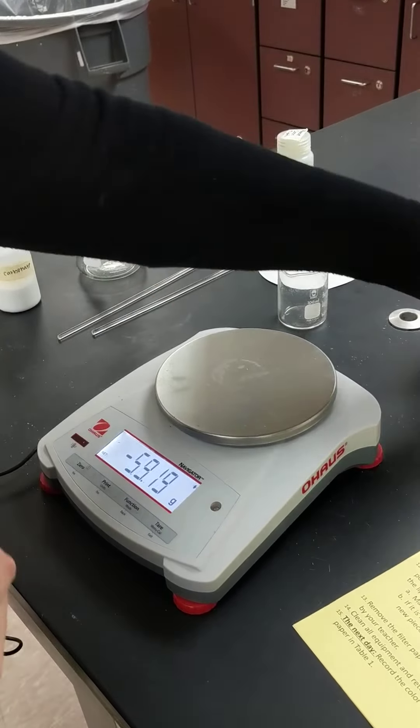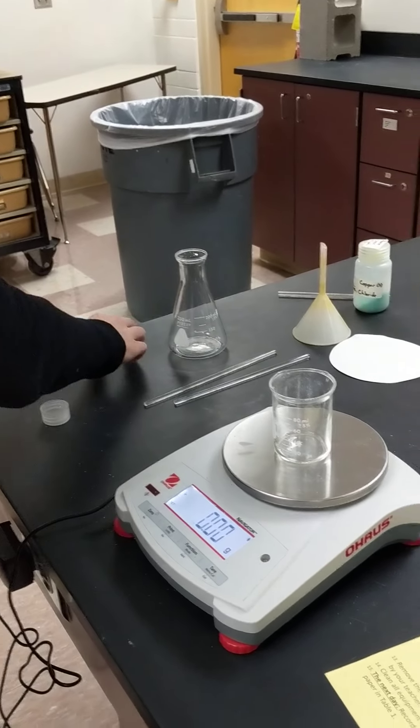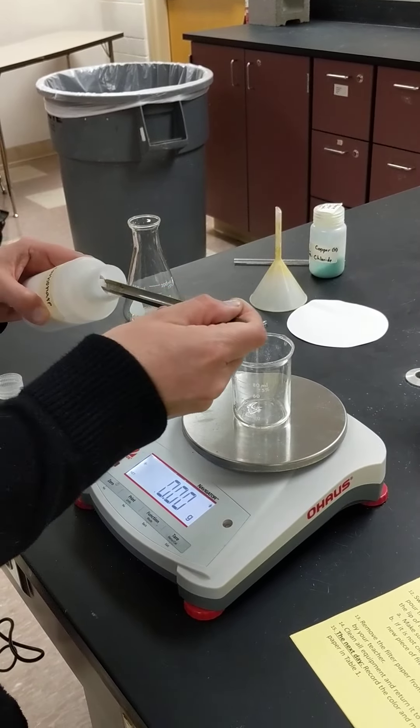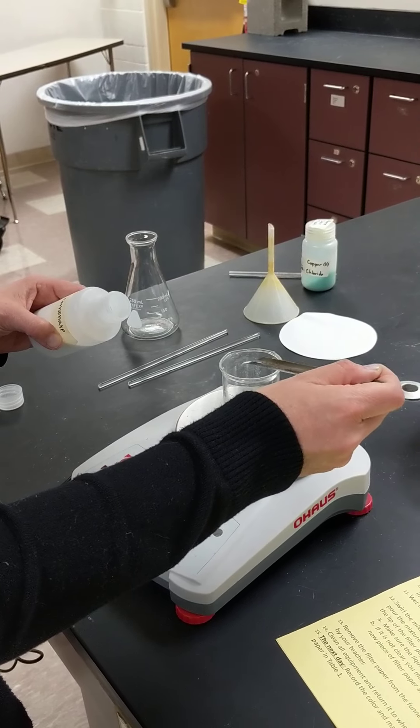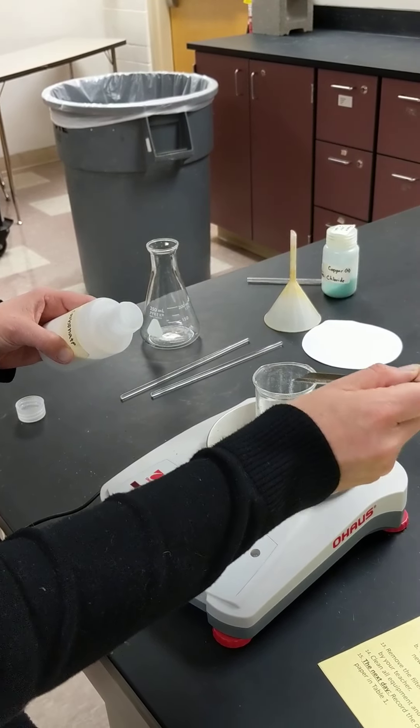And then we're going to do the same to this guy and we'll tare that using a different scoopula. We're going to try and get... we'll do 0.58. And this is sodium carbonate.